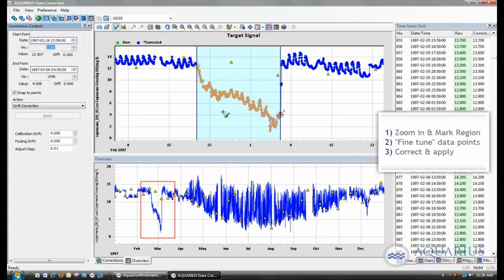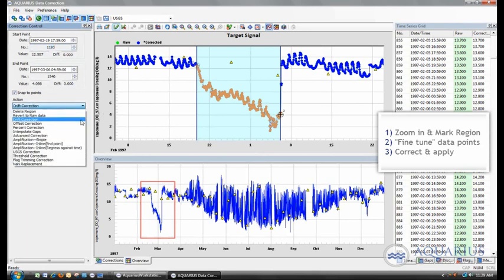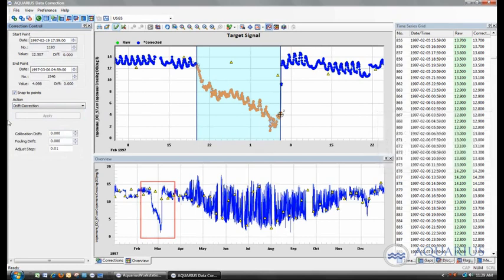So this is the region where we're going to apply the correction, the drift correction, and we select that drift correction in the action drop down menu, and we have two options. We have a calibration drift that we can apply to that data set, or we can apply a fouling drift. And all this means is when it comes to log it within that correction history manager, it will basically put in this is a calibration drift that was applied to the section of data, or a fouling drift. So it's purely kind of a label.